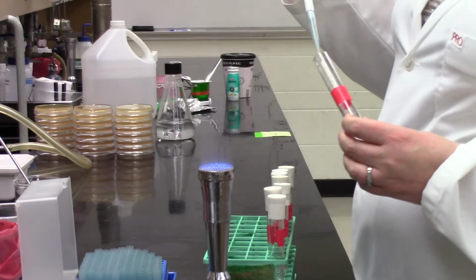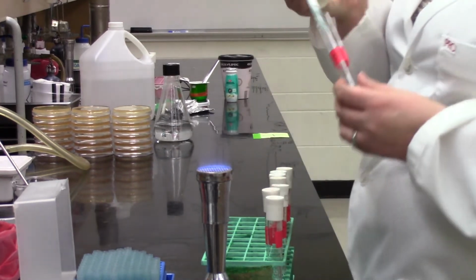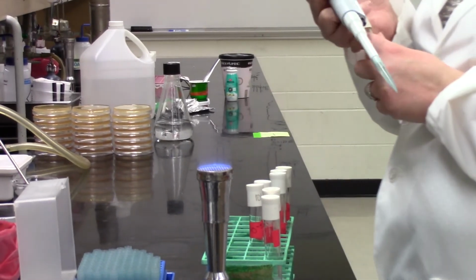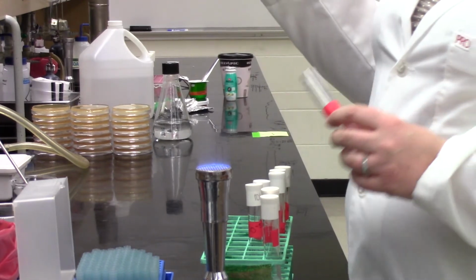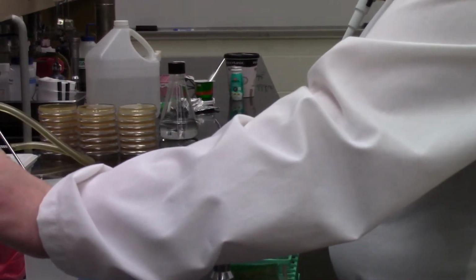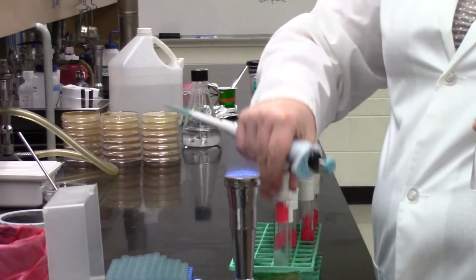You want to be really sure when you're doing these dilution series that you're keeping really good track of where you are. One of the things that I know myself, often I would make mistakes in, is I would get a little bit distracted, and I'd be like, which one have I taken from? It's very hard to tell. Once you're pipetting 1 mil, you can see the increase in volume, so you can figure out sort of which ones you've added to. But when you're working with the smaller, the 100-fold dilutions, it's hard.